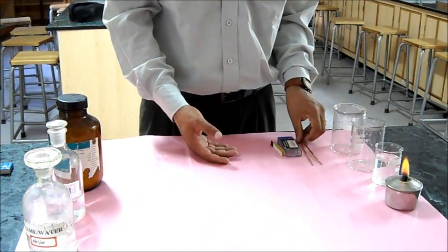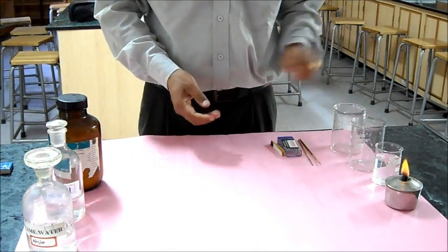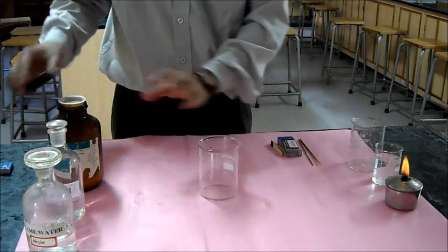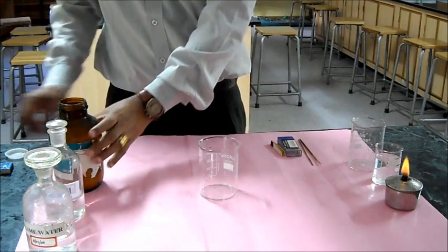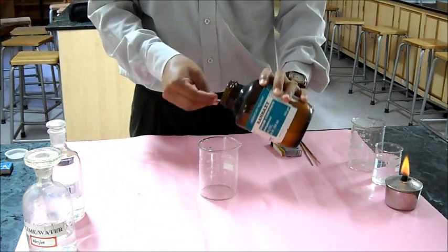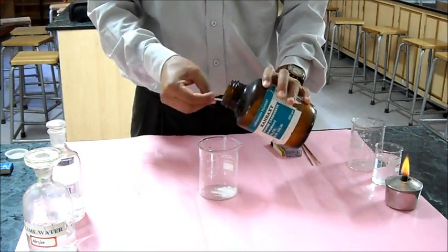First of all, let me take some metal carbonate. I take this sodium carbonate in the beaker.